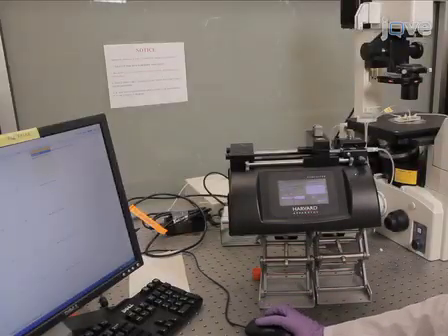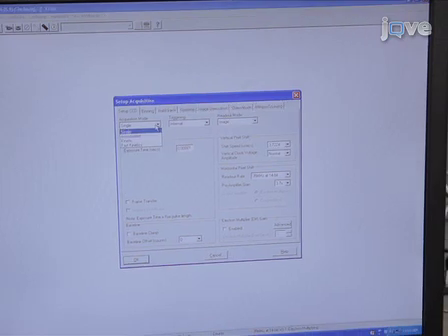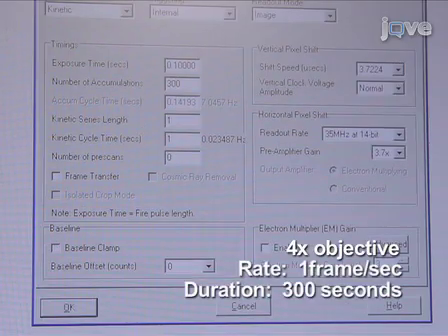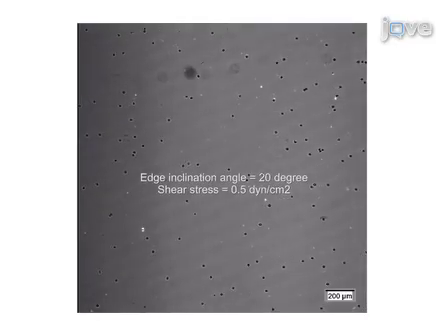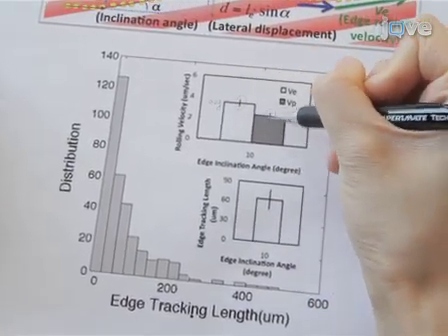Now, with an inverted microscope and mounted camera, record HL60 rolling interactions with adhesive p-selectin substrates using a 4x objective at a rate of 1 frame per second for durations of 300 seconds. Perform 3 independent experiments. Present the data as mean and standard deviation of the average values obtained from each experiment.